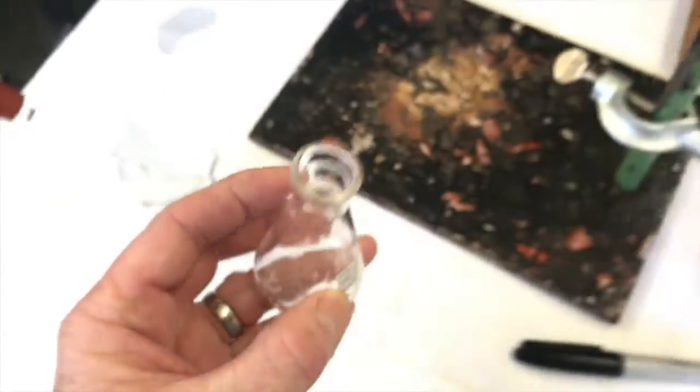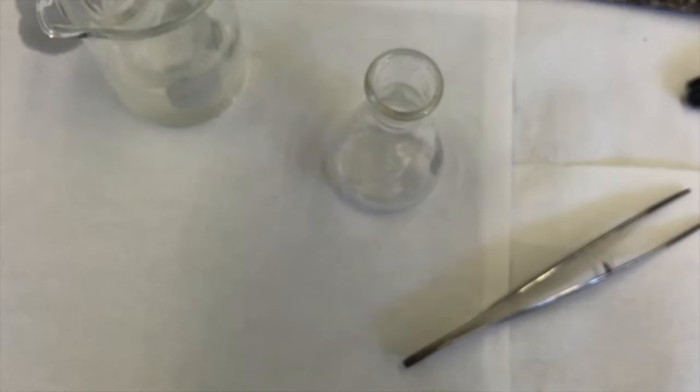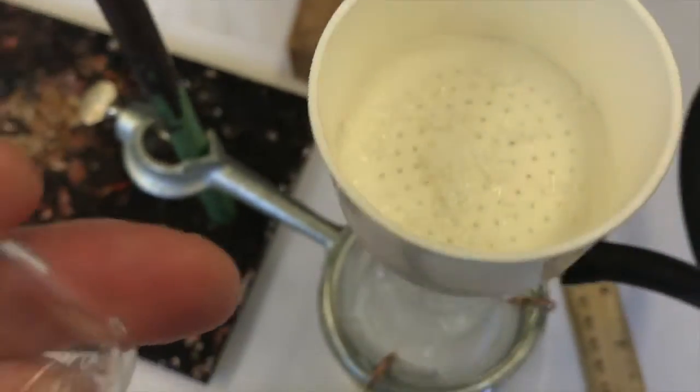I'm going to try using the cold methanol to rinse those into the filter flask, but I'm going to be gentle with this. I'm going to add just a little bit of cold methanol and swirl it around and look at it and make a decision. Is it dissolving those last bit of crystals too much? Because if it is, I don't want to pour it on my other crystals. No, it looks okay. So I'm going to swirl a little bit, dump it as well. This is doing two things. It's getting out more of the crystals, and it's also washing my current crystals with clean methanol to rinse off mother liquor with its dissolved impurities.